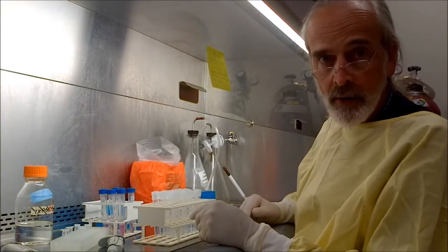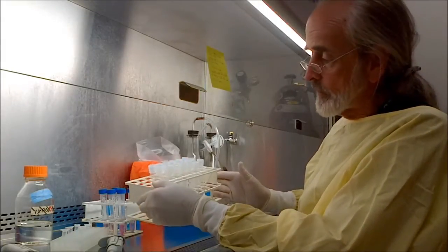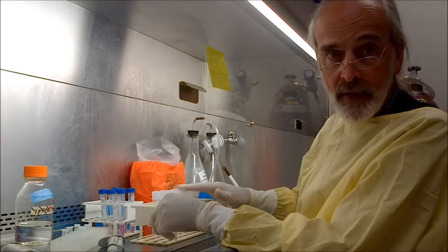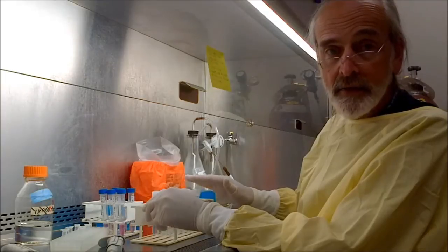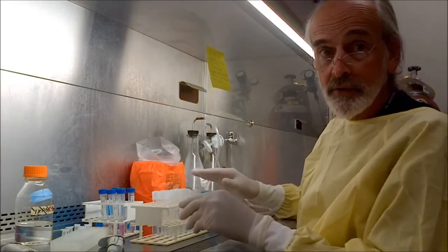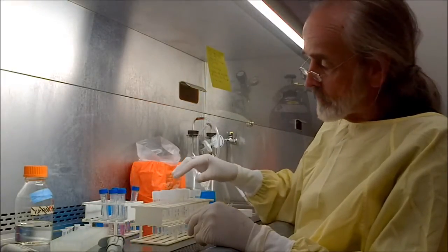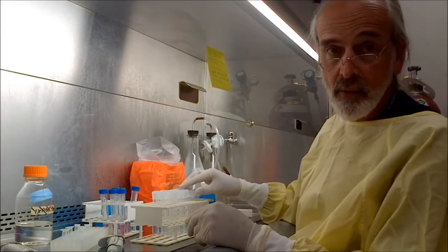And what I'm going to do now is make dilutions of the virus that was in the GCT into these tubes, and use this in turn to infect a new set of cells, and we will use that infection as a measure of the efficiency of the virus in infecting GCT. So in other words, if there's no virus in here, that means the GCT wasn't infected. But if the cells that I use the dilution on today show infection, then that means that the GCT was infected by the virus.